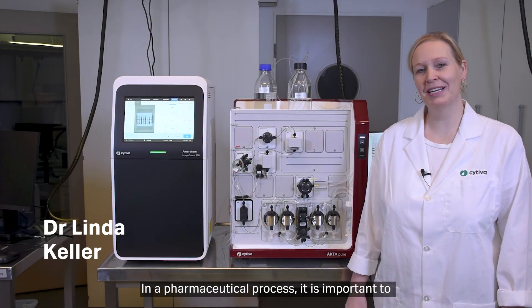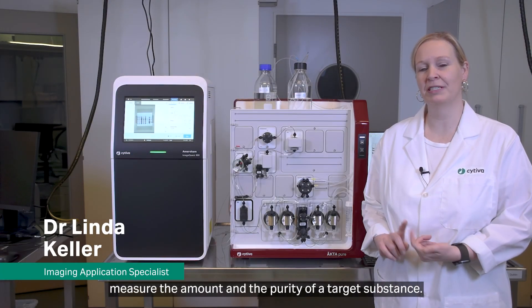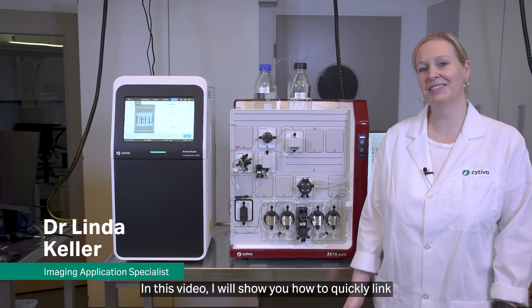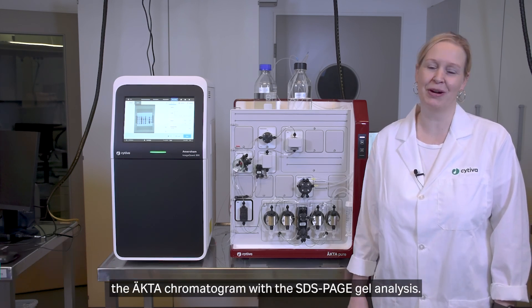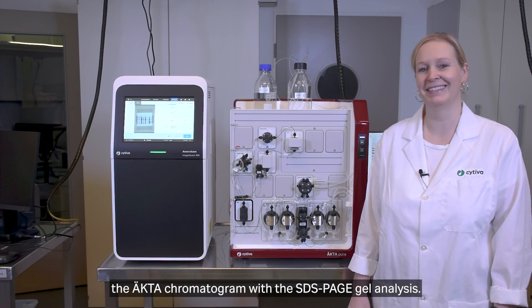In a pharmaceutical process, it's important to measure the amount and the purity of a target substance. In this video, I will show you how to quickly link the ÄKTA chromatogram with the SDS-PAGE gel analysis.